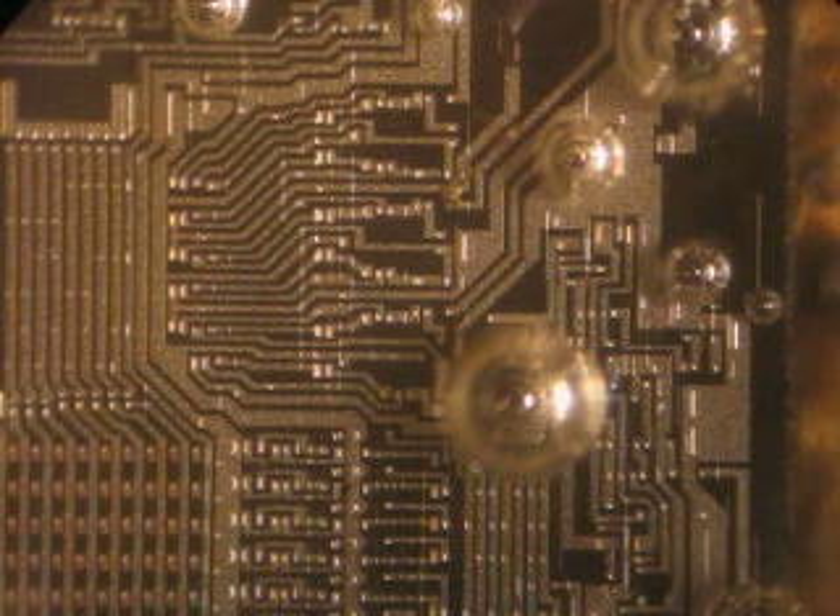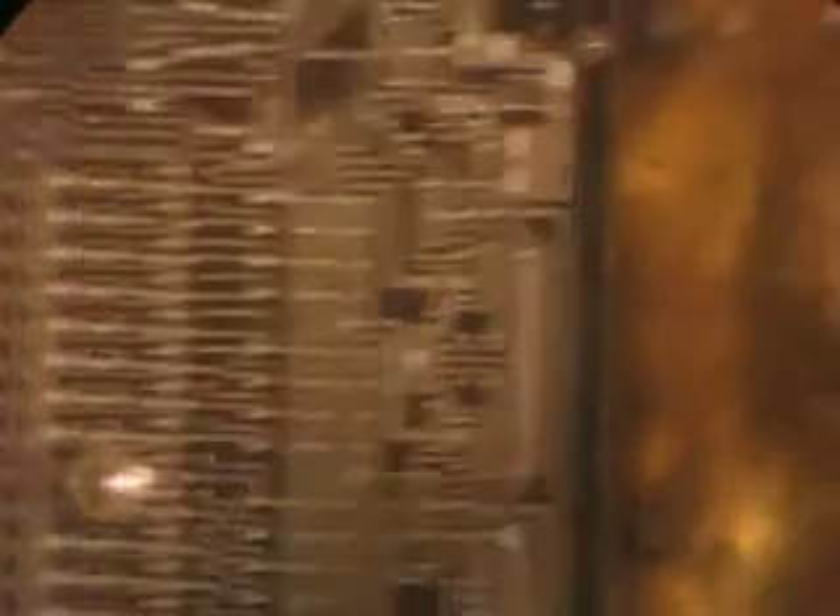Looking around on other parts of the casing, however, we can see that the acid was — let's see if we can get a focus on this — eating away some of the other metal parts. It might have been just an initial layer of debris that was eaten, just from the chip sitting out, dust particulates and such. I'm seeing very little action of acid on the chip.